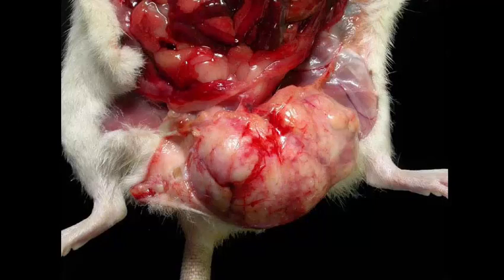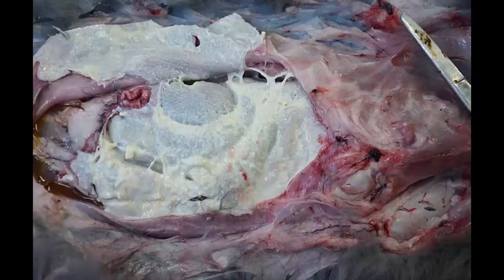Okay, moving on to slide number 4. This is tissue from a rabbit. How about a morphologic diagnosis and a cause? Okay, well, hopefully you've been looking at the rabbit videos that I'm currently in the process of recording.